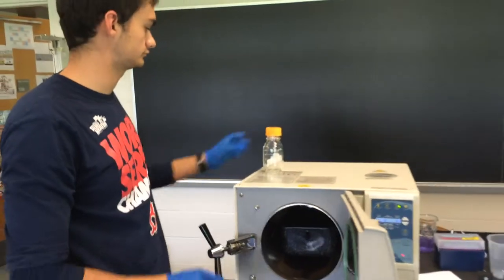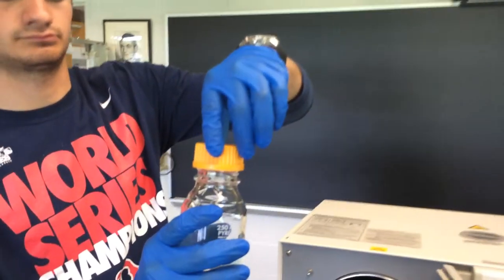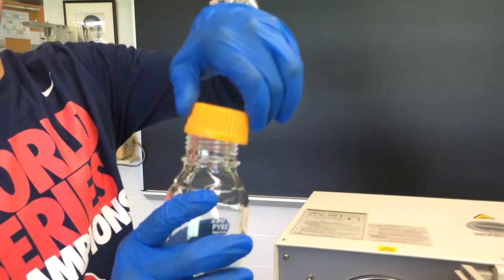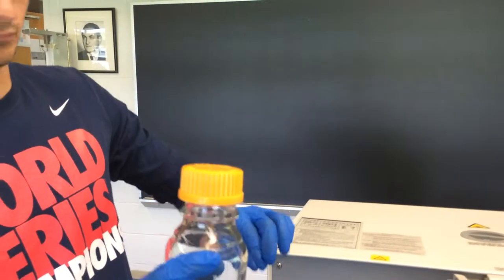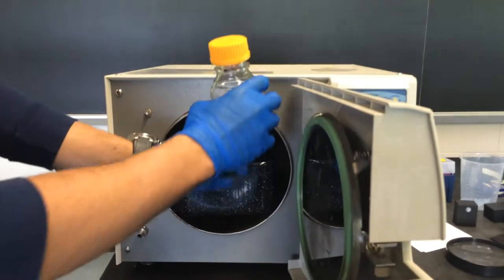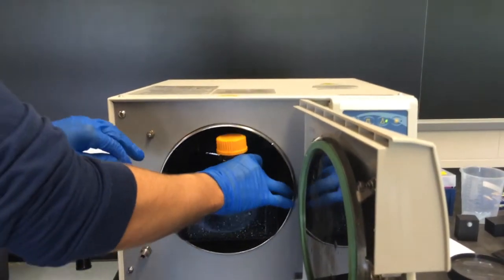Also, if you're putting a screw cap bottle or a media bottle into the autoclave, make sure it's not tightened. Make sure it's loose so that it doesn't explode. The autoclave is a high pressure device.